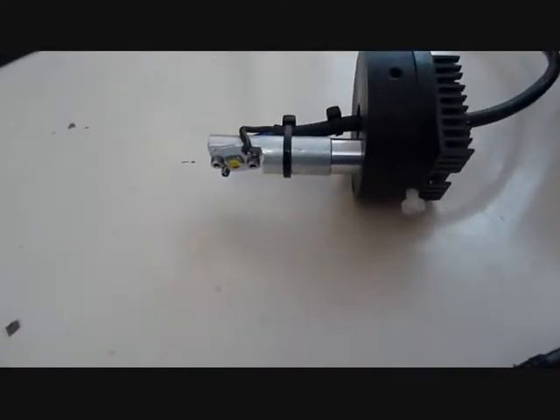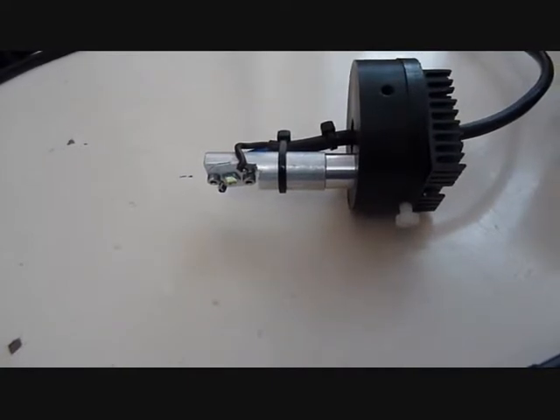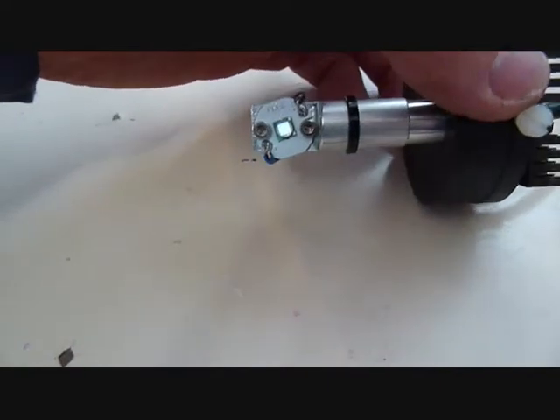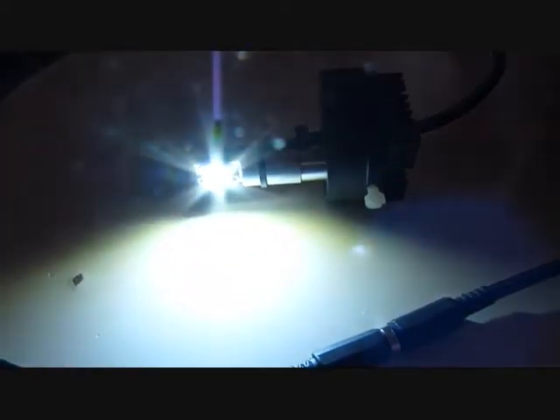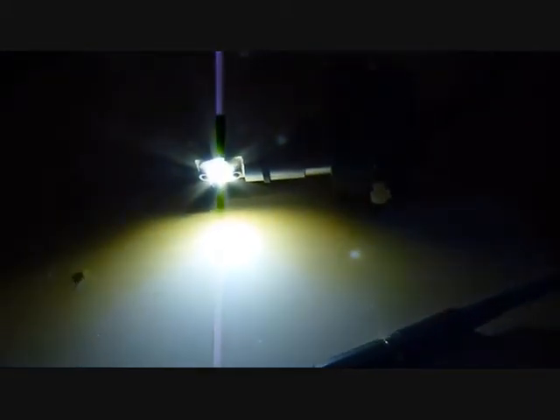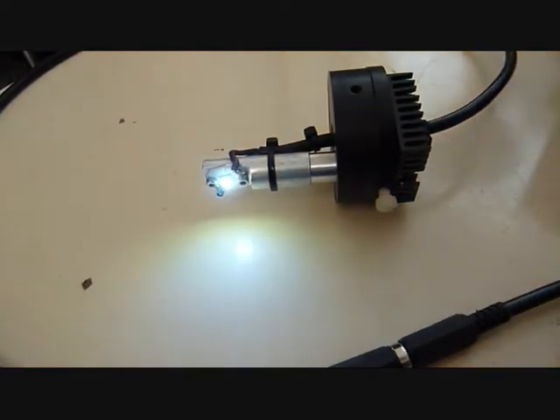Control box here for the LED — really good controller. You can just see it lighting up there. That's at its minimum brightness. And you can increase up to pretty amazing light outputs from these LEDs. So you've got full control there.